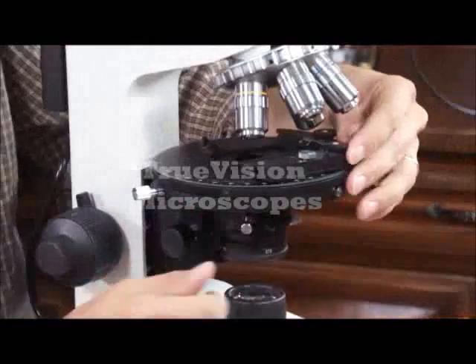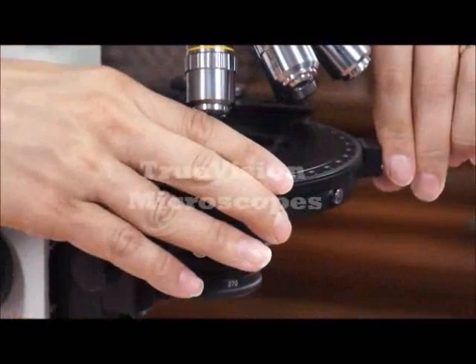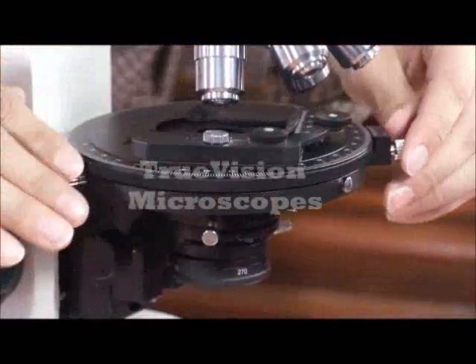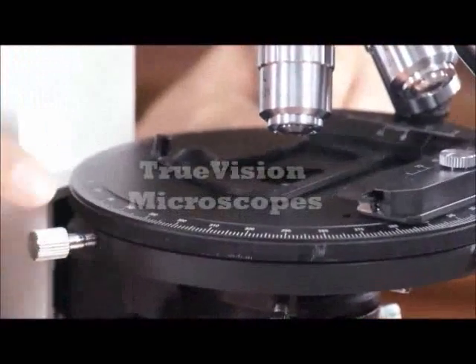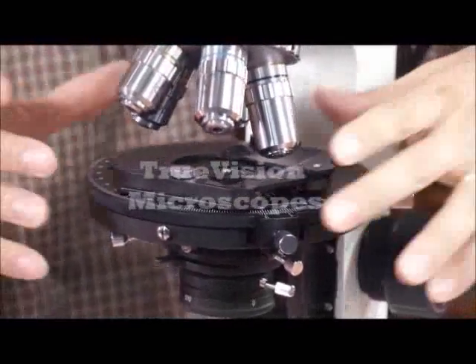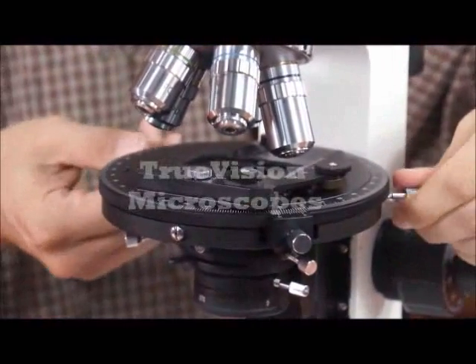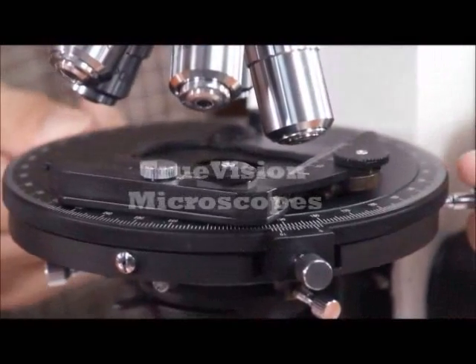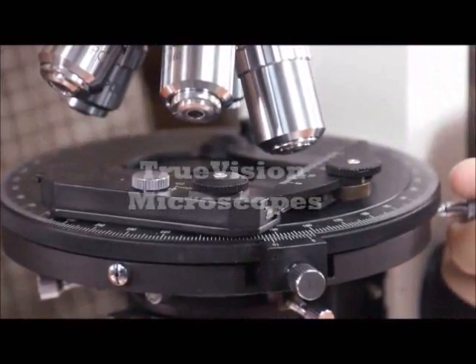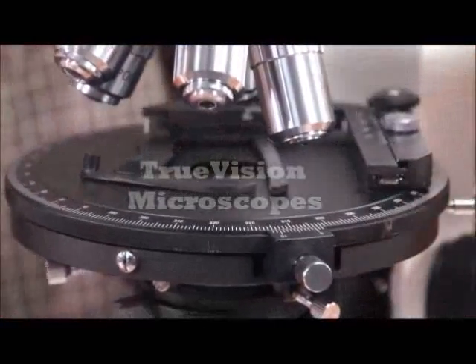This has a rotating stage. This screw is to stop the rotation so it cannot rotate. You loosen it up and it rotates — it's 360 degrees marked every one degree. This knob and the corresponding knob on the other side are for centering the stage. You want to look into the eyepieces and rotate the stage and see that the specimen stays at the center.